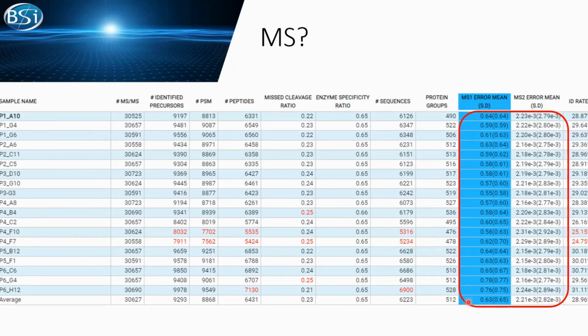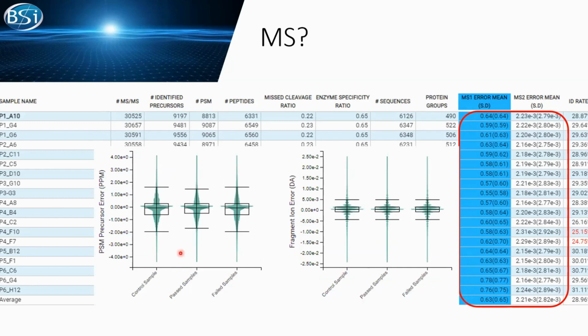Therefore, it's unlikely. Furthermore, we give a violin chart of our control samples, pass samples, and fail samples, showing their PSM and error distribution. We can see that between the pass samples and fail samples, their mass spec error is very similar, same as the fragment error. So now we can tell, okay, MS is not causing a problem in my run. Now we have gone through some data in the untargeted analysis. Can targeted analysis provide more evidence?